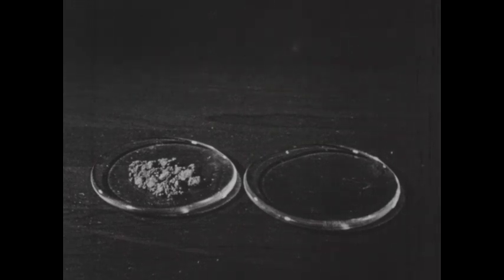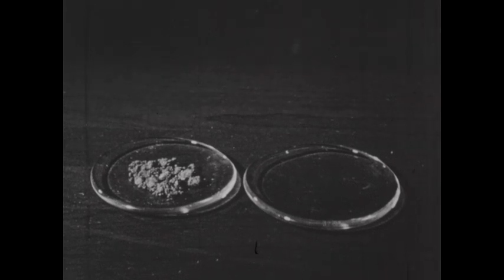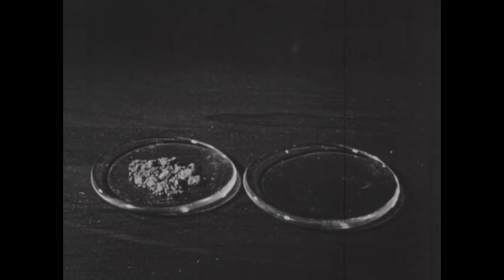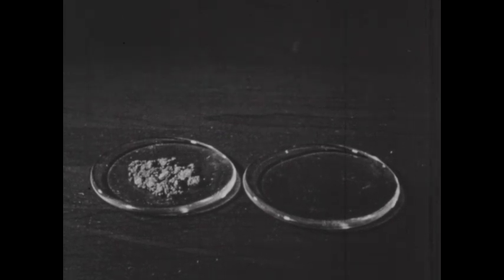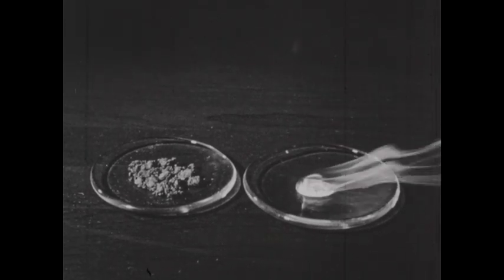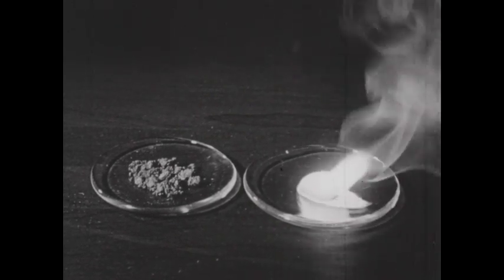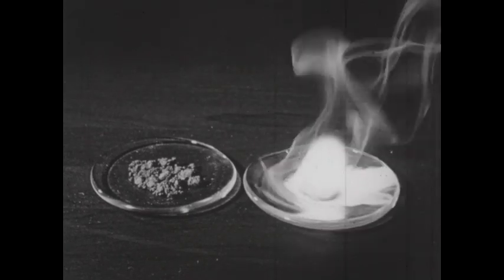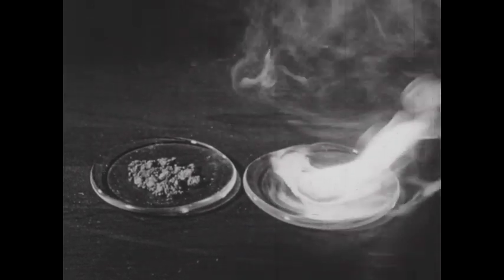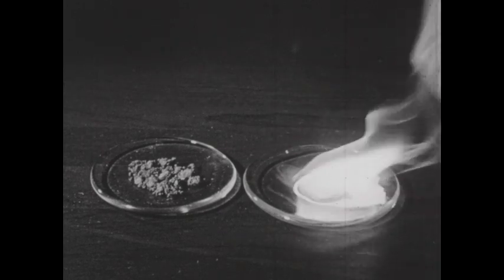We can compare the activity of red phosphorus and white phosphorus by exposing samples of them to the air. A small sample of red phosphorus is on the watch glass on the left. The watch glass on the right has been warmed very slightly, and a sample of white phosphorus is placed on it. You can see that the white phosphorus almost immediately bursts into flame and burns with the production of large clouds of phosphorus pentoxide, whereas under virtually identical conditions, the red phosphorus does not react with the oxygen in the air at any appreciable rate.